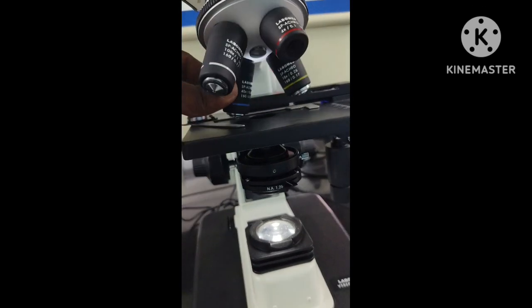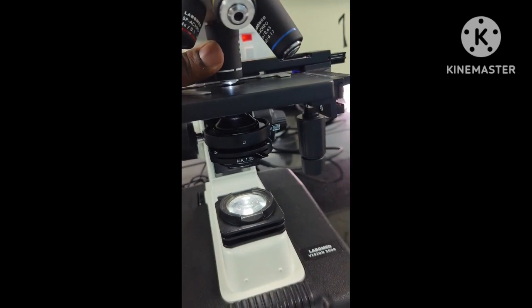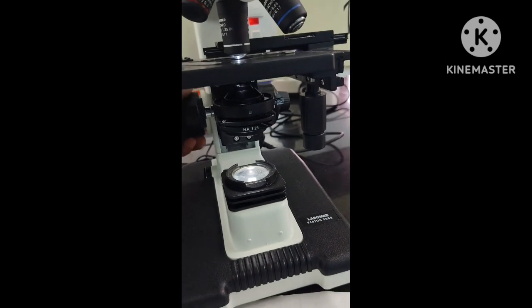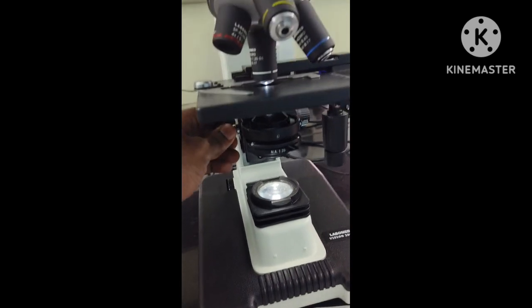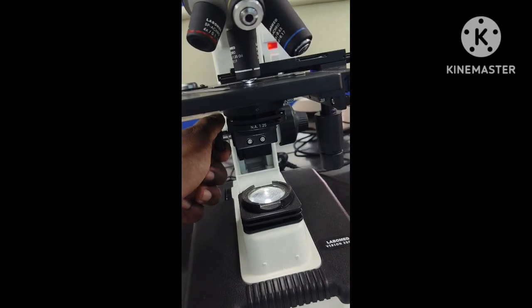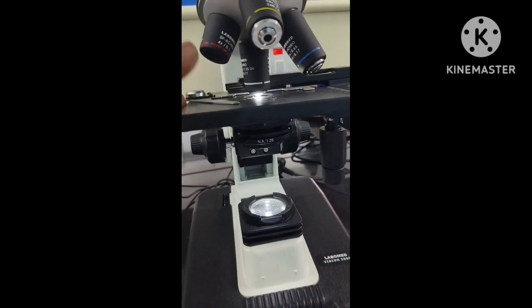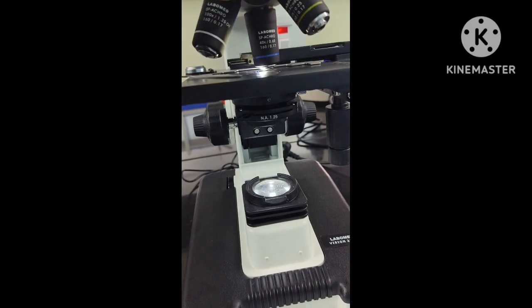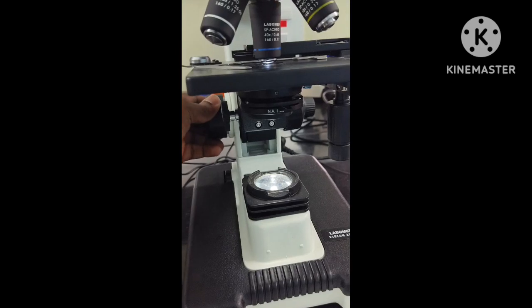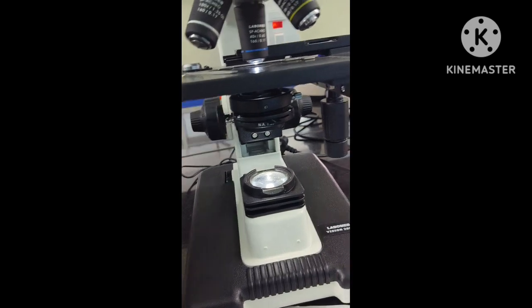Now, next is your high power. Let's first learn oil immersion, because oil immersion requires the highest amount of light. So you take this screw and put it at the highest position. So this is your adjustment of the condenser. I'm raising the condenser to the maximum. At this point you will have the maximum light going in, and you have to completely open the lever of the diaphragm, full light. And what will be the adjustment for the high power? Midway between these. Adjust the diaphragm lever to midway and lower the condenser a little bit, between low power and high power. So around this way, half adjusted.